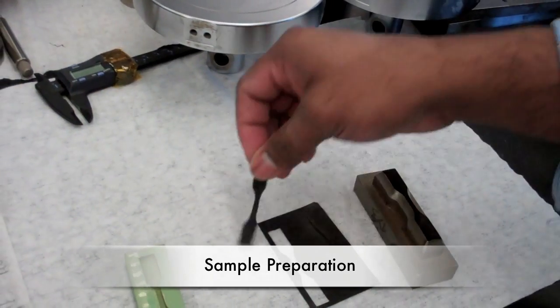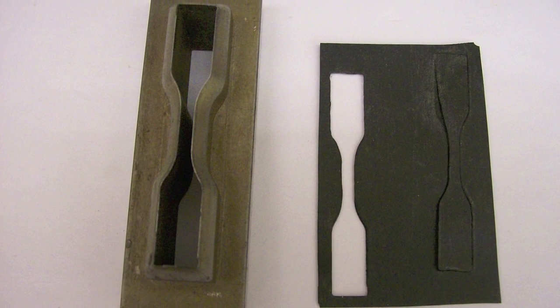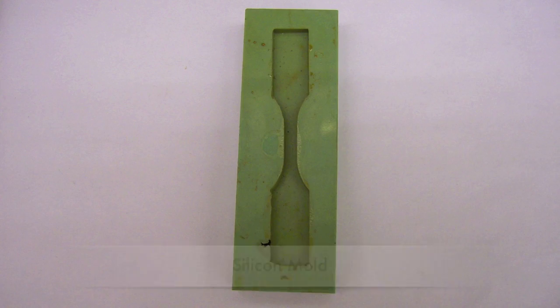There are different methods used to prepare samples. One example is a punching tool used with a hammer to cut out the dog bone sample from a film. There is also a mold used to cast samples from a liquid monomer.